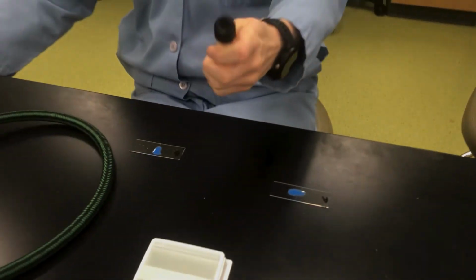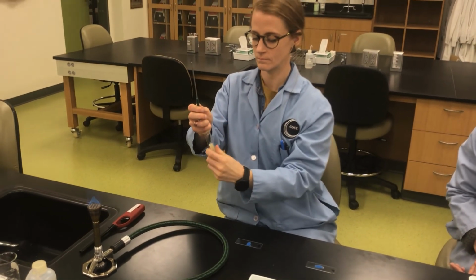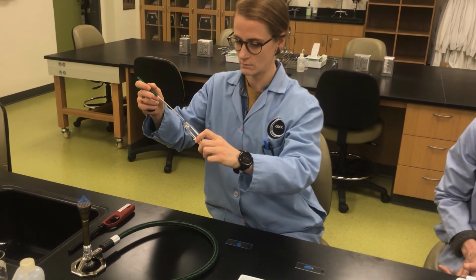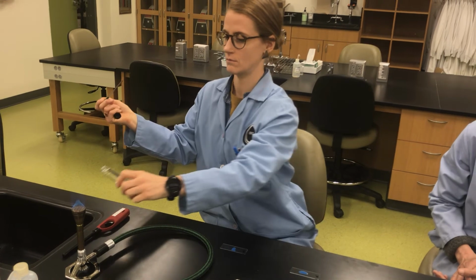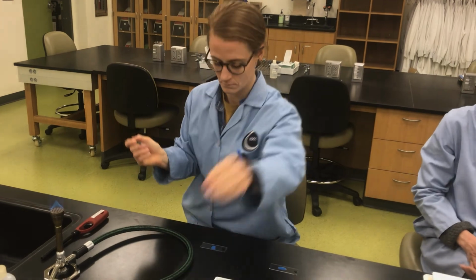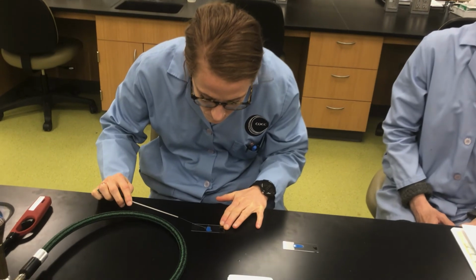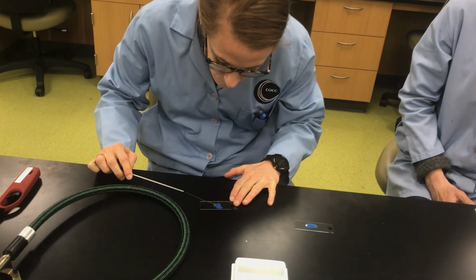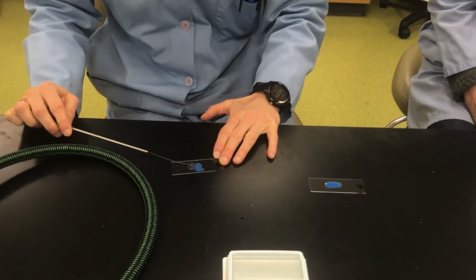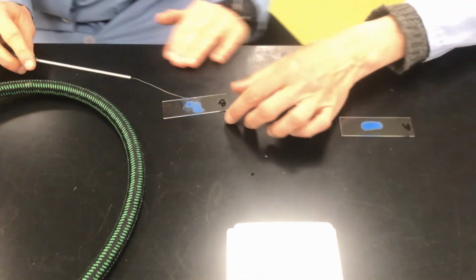Add a little bit of culture B's sample. I just flamed my loop, so we're good. Again, add some of that culture to the slide and then mix together. Get a nice mix. And then would you like to tilt that for me? I would love to. Thank you.